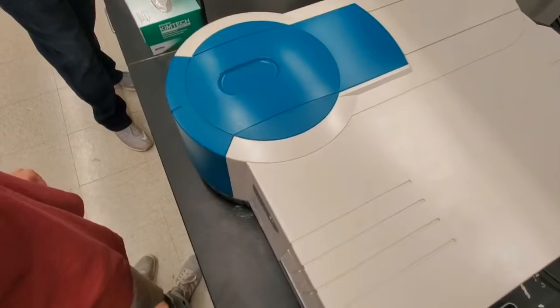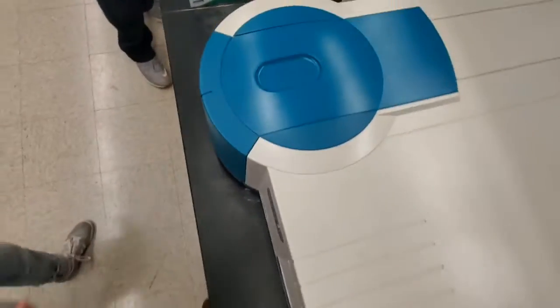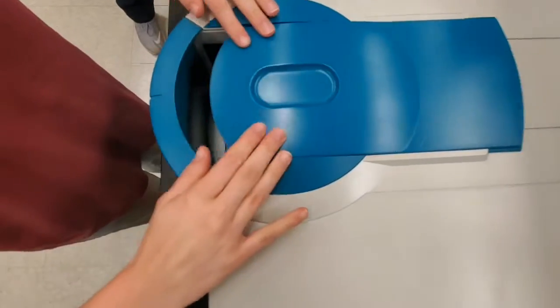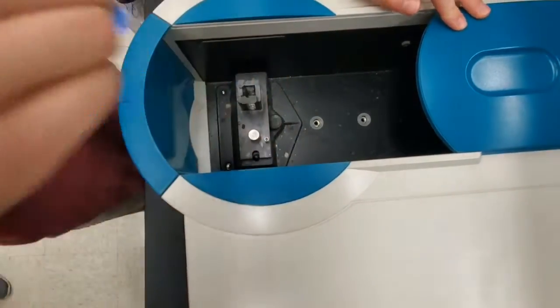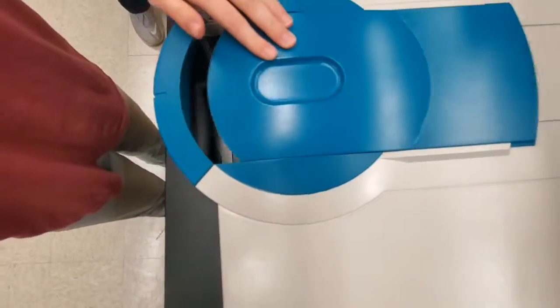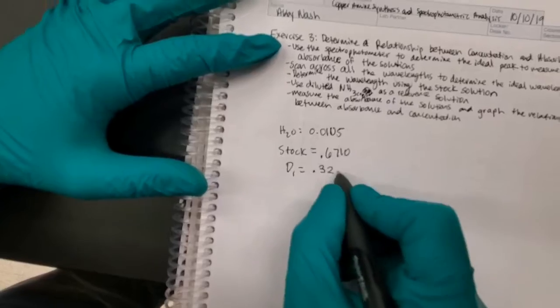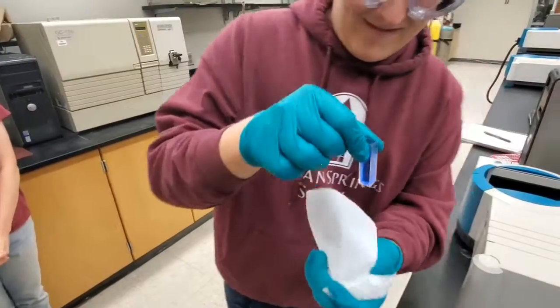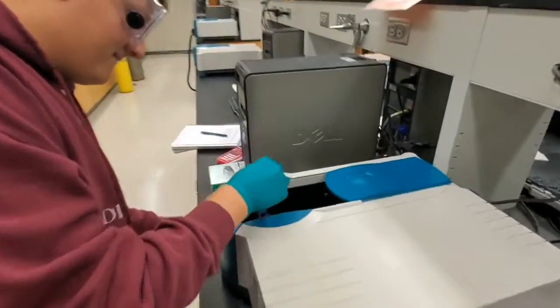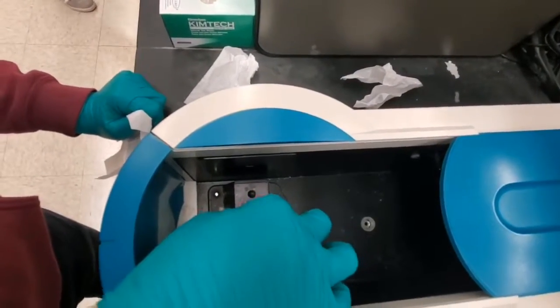Absorbance can be measured using the spectrophotometer. Epsilon can be determined as the slope of the calibration curve between absorbance and concentration, and L is always equal to 1. As long as you have the measured absorbance value or have calculated the concentration, epsilon can be calculated. Or, as long as you have epsilon and absorbance, concentration can be calculated using the Beer-Lambert law.